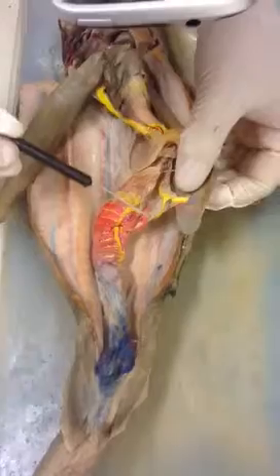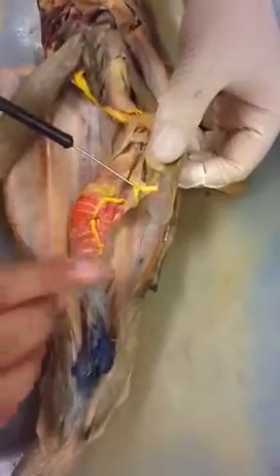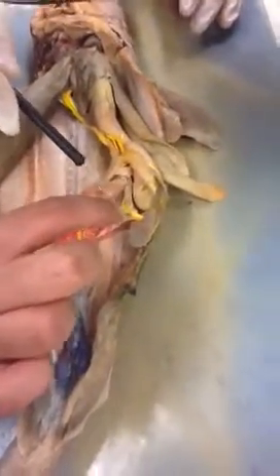So the two posterior feed into your pancreatic. These two, right? Feed into your lieno-mesenteric vein. Excuse me, that's your lieno-mesenteric, if you look in the portal system. Which one's the lieno-mesenteric? That one right there, that yellow one. What about this one? That's your posterior intestinal vein. And that's your posterior splenic vein. So it's actually one and one.